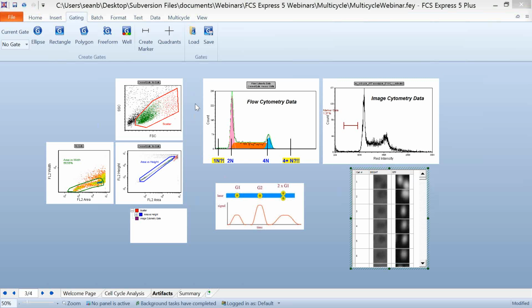All of these things must be taken into account. And what we've done here is we've set a marker gate to give you a little bit of an example of what can happen here. When we apply this image cytometry marker gate to our images, we can see that when we look at cells that are kind of falling on the low end here, there's some blanks. There really isn't anything going on there. These might be just segmentation artifacts where the computer thought a cell was there, although nothing existed.